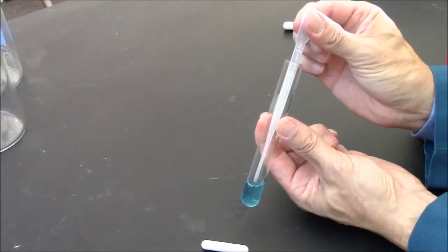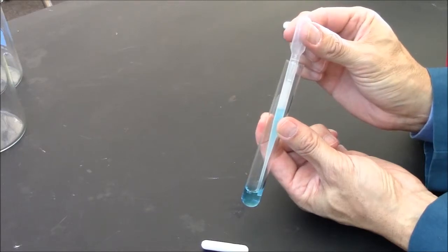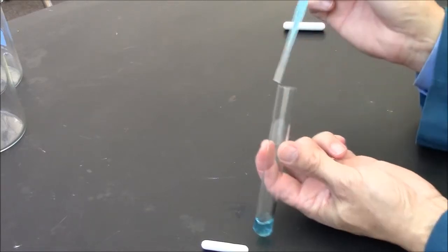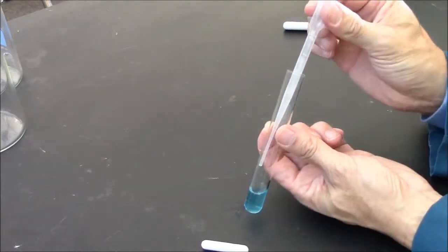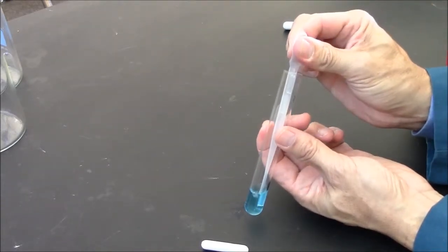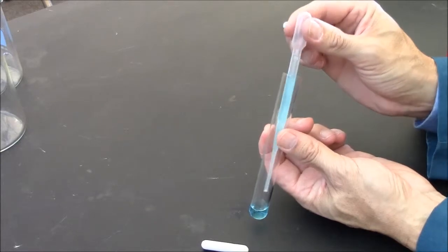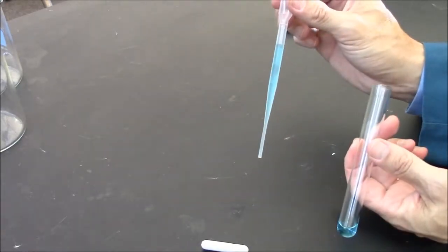If you have great skill, you'll be able to pull up one milliliter right on the line like so. But it may be easier to just go past one milliliter. So I'm getting a whole bunch in here. That's about a milliliter and a half.